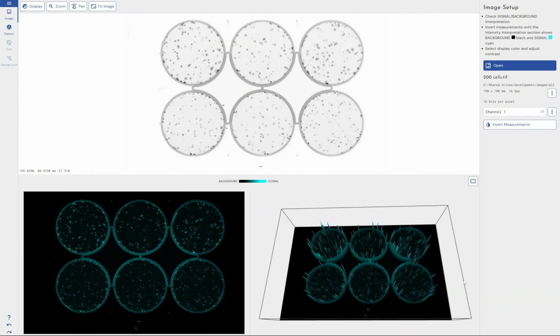Now, by using Phoretix Colony Counter, you don't need a specialized ELISpot reader, of which there are a couple automated solutions on the market. You can use a normal gel doc device, a scanner, even your phone camera if none of those options are available. So by using our software, you don't need any specialized equipment, just need a way of taking a high quality image of your wells, bring it into the software, and I'll show you through the course of this video how we can get a spot number and start getting intensity of spots.